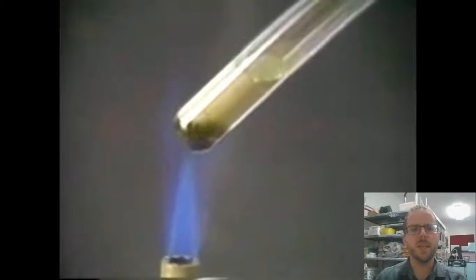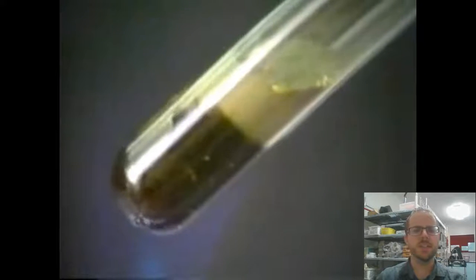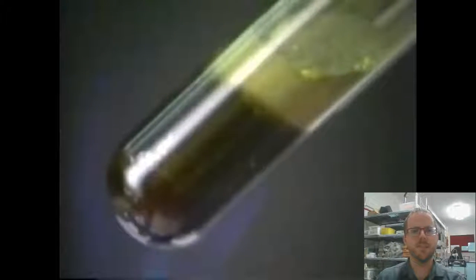But let's say that we took that mixture, took that combination, and we heated it. We're heating it strongly. So what happens initially is that sulfur, that yellow powder, starts to melt and distribute its way through the iron filings, and it keeps being heated. And what you can see is that then we're starting to get a different kind of change happening here. As we continue to heat it, we end up with this singular kind of grey substance. We've made what we call a compound, iron sulfide.